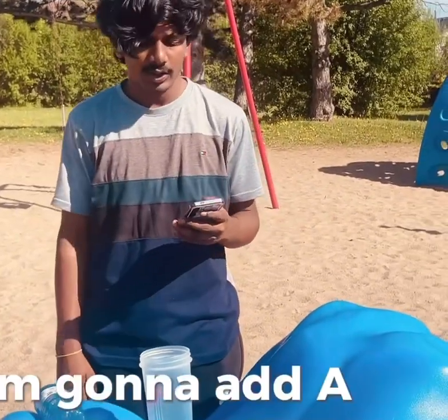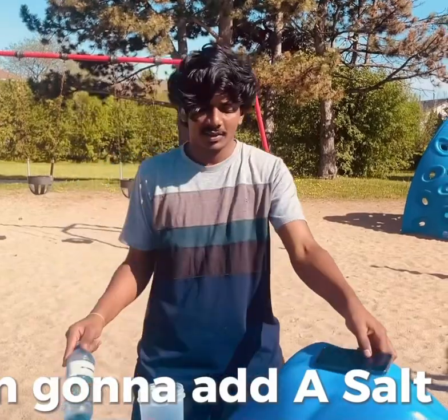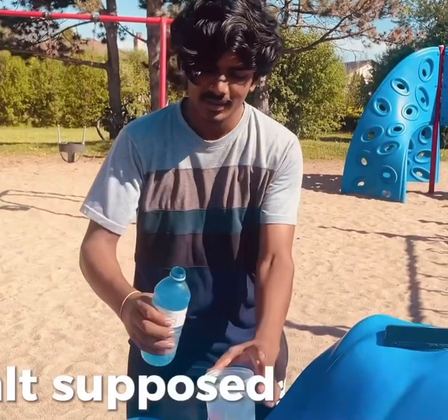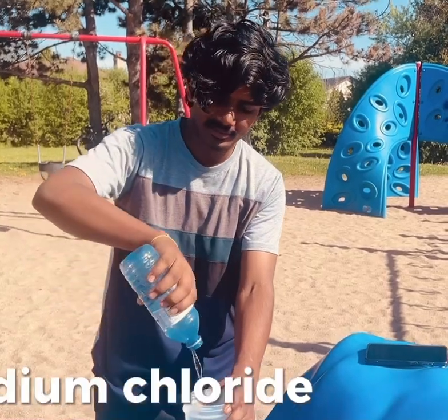I have 500 ml of water, 5.9 grams of NaCl, a teaspoon, and some equipment to use. Now I'm going to add the water into the container. The container is supposed to be dry and clean, and I'm going to add the salt to it and mix it with the water. The salt is supposed to dissolve a lot.